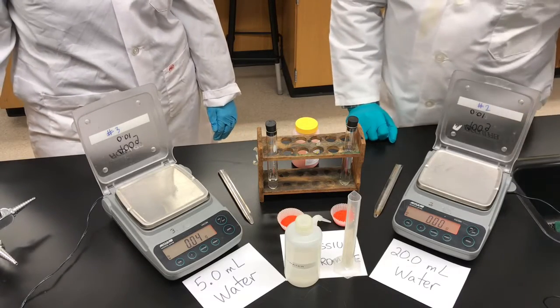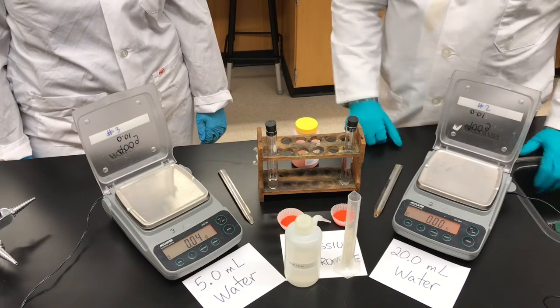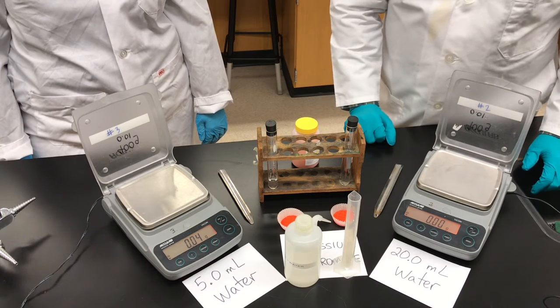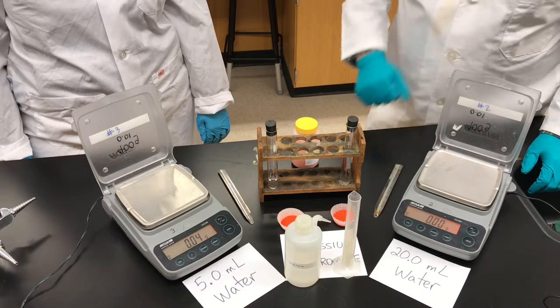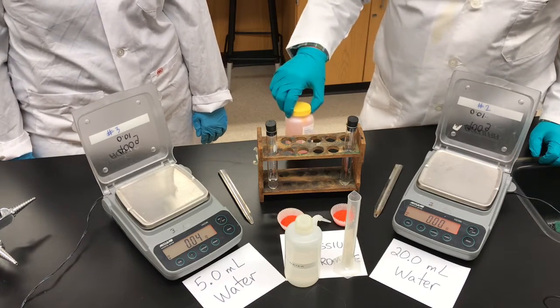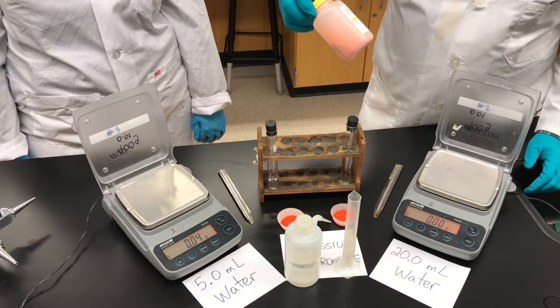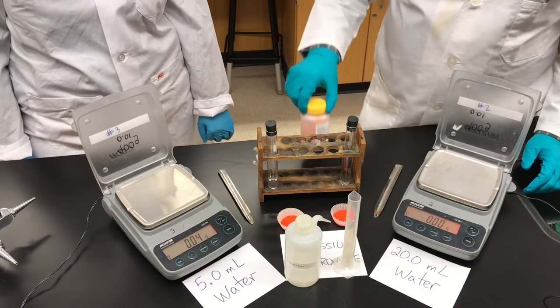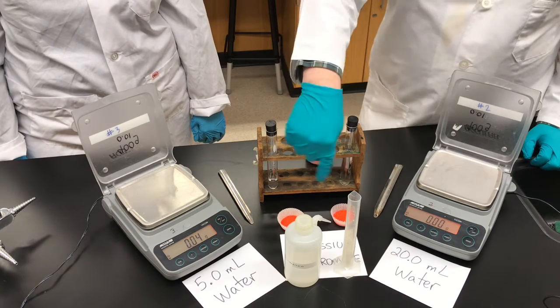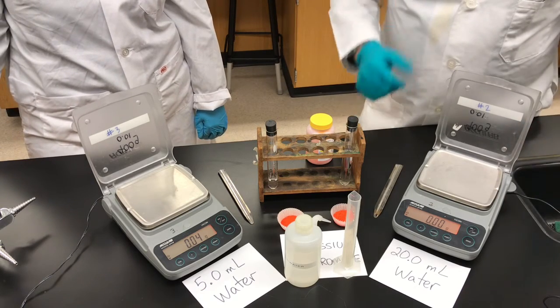Welcome to another grade 9 advanced science video — a coronavirus lab video that will replace an experiment normally done at the beginning of our third unit on solubility.